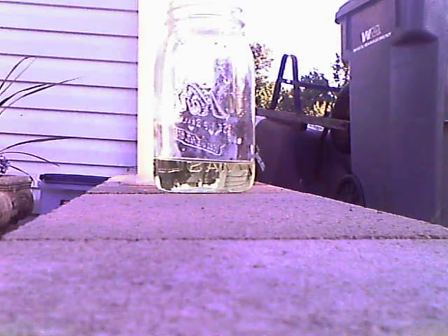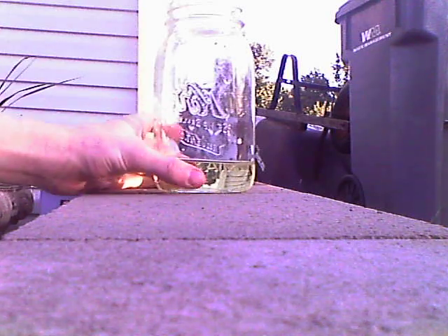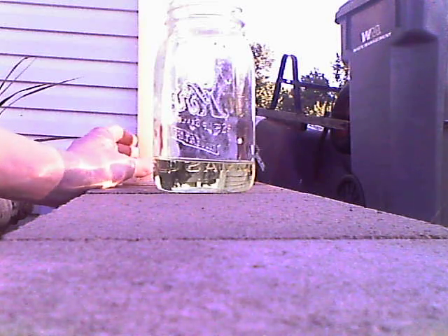Welcome to 42 Super Nerd. This is a video on homemade hypochlorous acid made out of 100 milliliters of sodium hypochlorite and 100 milliliters of citric acid — this is 5% and this is also 5%. Here is the sodium hypochlorite and here is the citric acid.